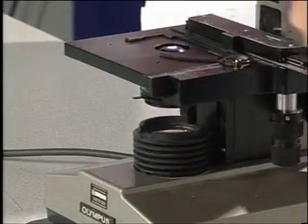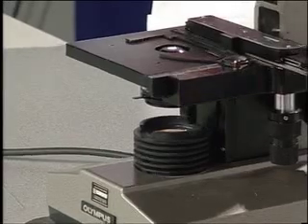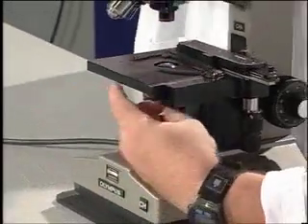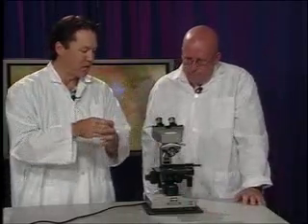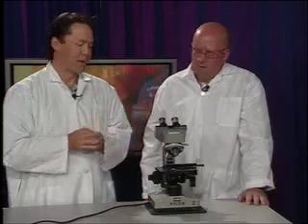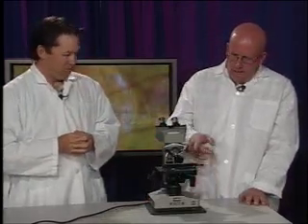So it's sort of a switch thing. It seems like it only goes 90 degrees. Yeah, it's just a little lever, and you move it back and forth. What it does is control the amount of light and the amount of stray light. When you use that device, you're going to have better clarity or resolution. You're going to have to play with it to figure out how it works. So I could do a combination of the light and the diaphragm to get the best looking specimen. Yeah, that's the ideal thing to do.